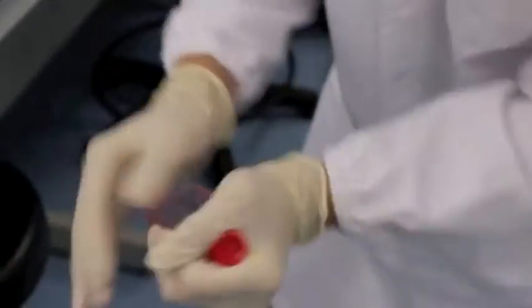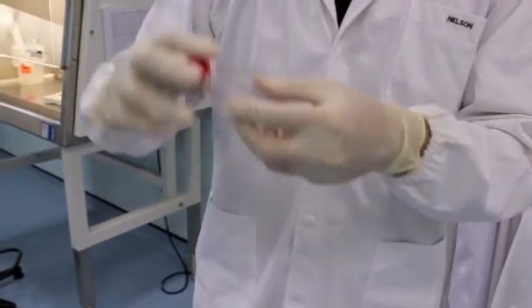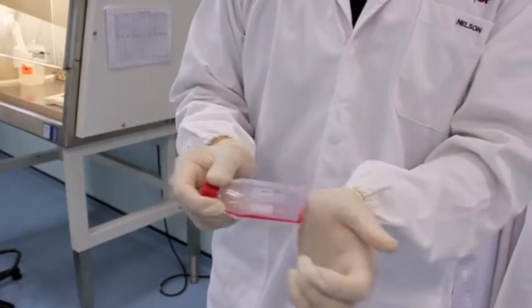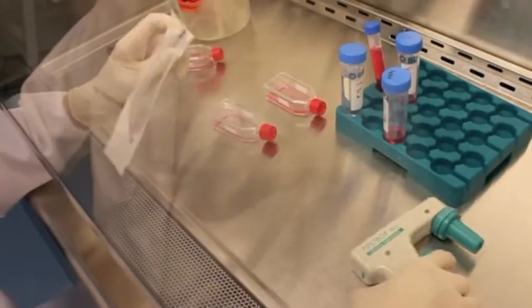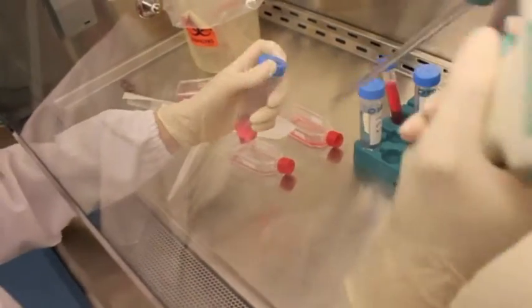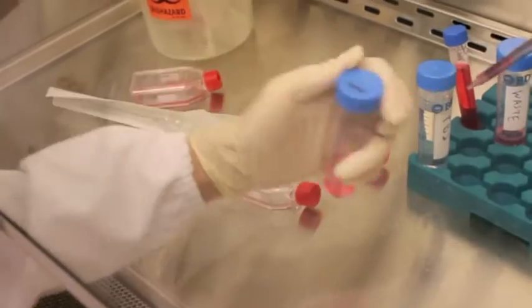After incubation with trypsin, do not do this. You should tap the flask gently to detach the remaining cells that adhered to the flask. Ensure that the serological pipettes do not touch anywhere except the solutions you use, such as media, trypsin, or PBS.